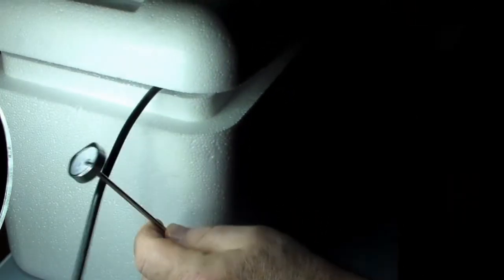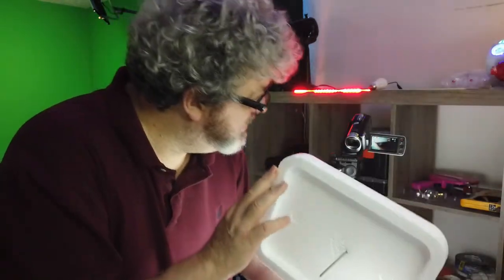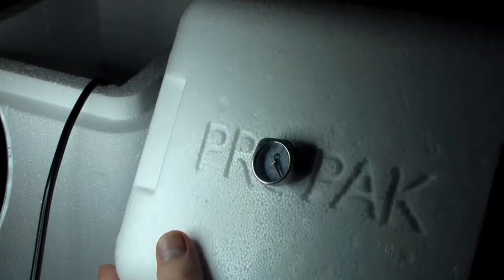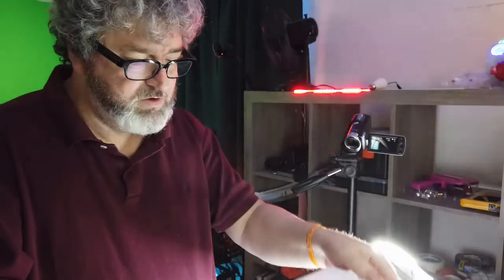And what I will do then is I will take a meat thermometer, this meat thermometer right here, and I will put it right to the lid, and I'll be able to take measurements of the temperature. So I'll be able to see the temperature, see how the thermometer goes through. I'll be able to take the temperature.